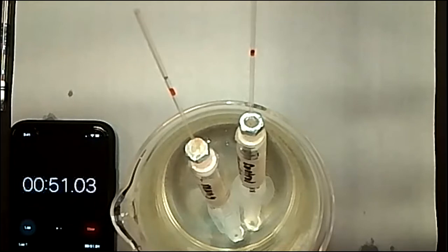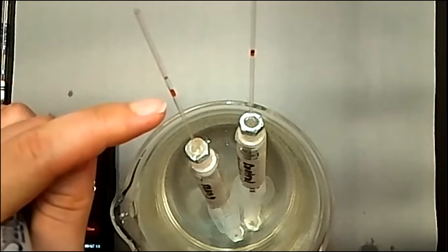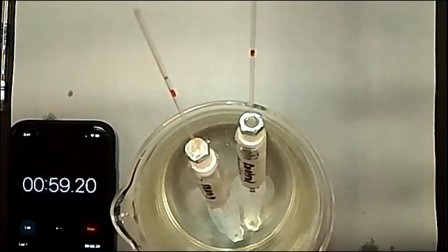As you can see already at 1 minute, the original mark for the cellular respiration with the mung beans was up here, but the manometer fluid has already moved down pretty far. So we could hit the base before we even get to 10 minutes, and that's okay. Sorry, I was just taking out paper so we could use it to see the results afterwards.